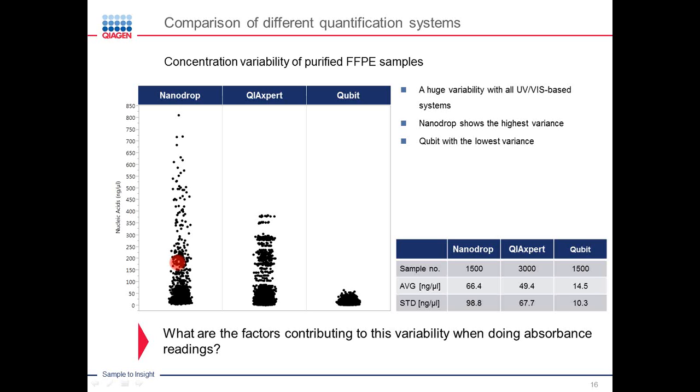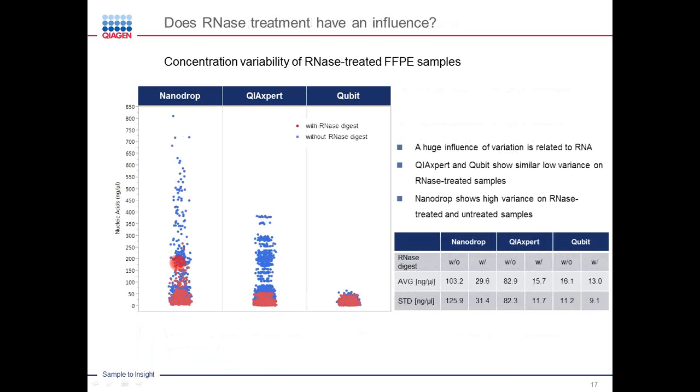So having in mind that on the qubit system, based on the fluorescent assays used, only DNA is quantitated, we first looked at the difference generated by samples treated with RNase versus samples not having been treated with RNase. And if you split out these data points by color, what we did on this slide here, you see now all the data points from the samples that were not treated with RNase in blue versus the data points from the samples that were treated with RNase in red. You can immediately see that the majority of the variation is contributed by residual RNA, I would say, that was co-purified in those samples that have not been treated with RNase.